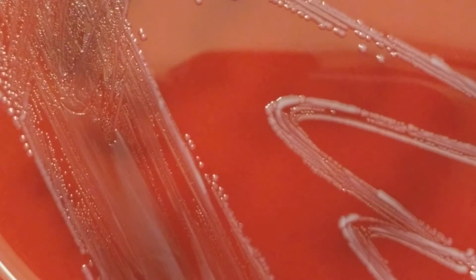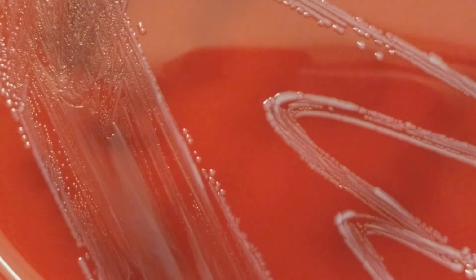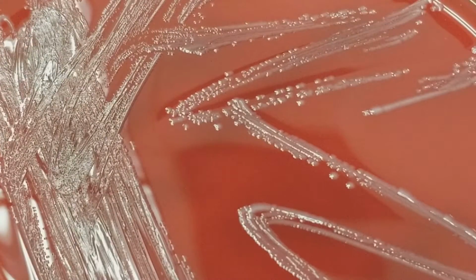It is from a urine. Okay, and just as we had talked about, this is actually Enterococcus faecalis. Okay, notice that this is not the streaking of a urine culture again, because I ended up getting pure cultures from the actual specimen.